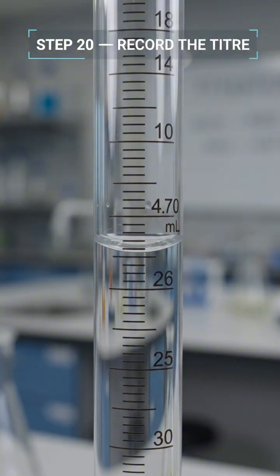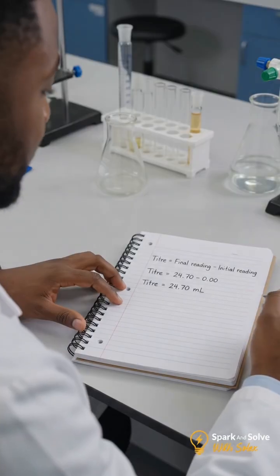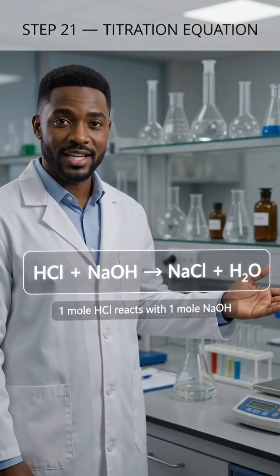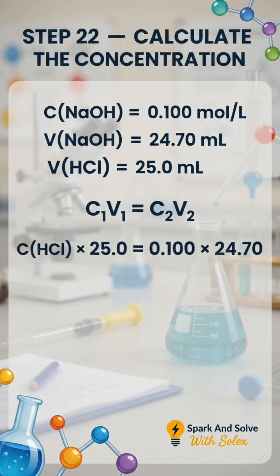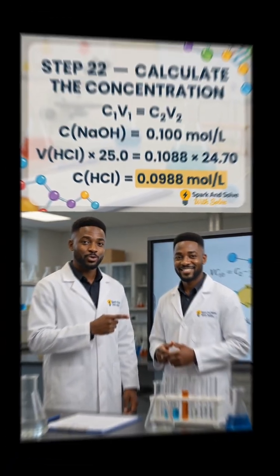Record the final burette reading, then subtract the initial reading. Here, our titre is 24.70 milliliters. The reaction is a 1-to-1 neutralization. Hydrochloric acid reacts with sodium hydroxide to form sodium chloride and water. Using C1V1 equals C2V2, the concentration of the hydrochloric acid is 0.0988 moles per liter.